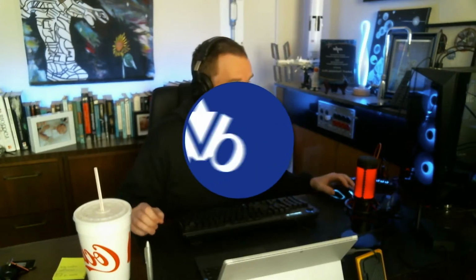We're in the middle of our microarray analysis here. We just loaded everything in and got our script set up, and now we're actually going to dive into a bit of the differential gene expression analysis. So without hesitation, let's get into it.